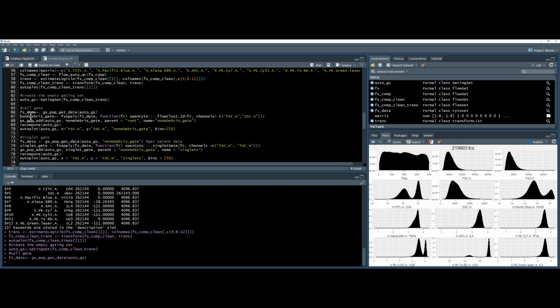So I'm going to create a non-debris gate. I'll be using fs apply. So fs apply is something we came across earlier, which is a way to iterate through all the files in a gating set, in a flow set, the data, the function, and we're going to be using OpenCyto. So OpenCyto is another package that allows you to use clustering algorithms effectively to get your information. So we'll be looking at flowClust2D on the flow frame, and this FR for flow frame comes from the function here, and the channels forward scatter area and side scatter area.